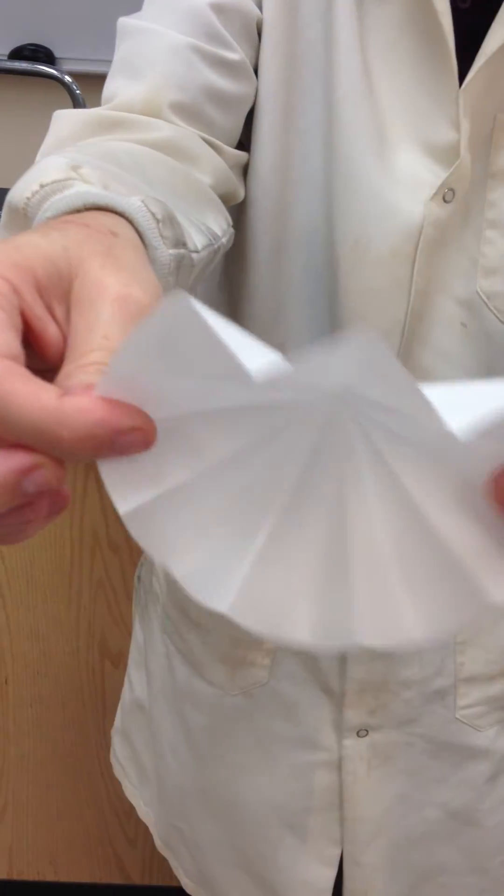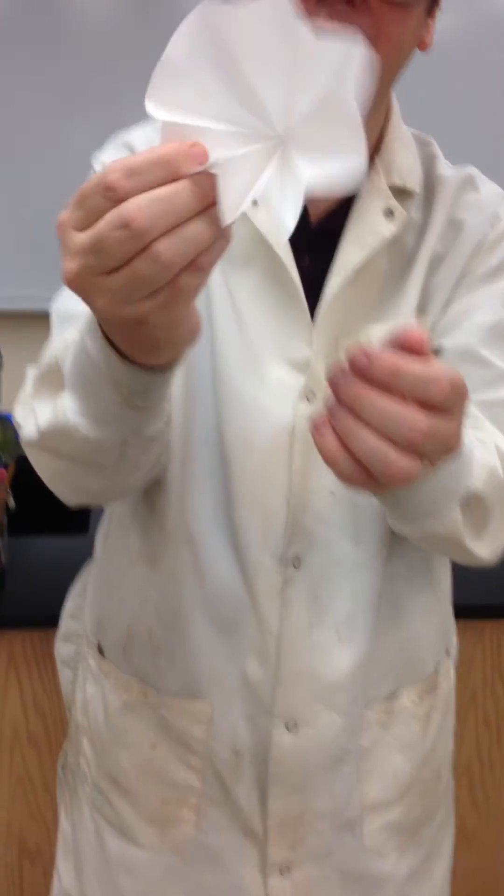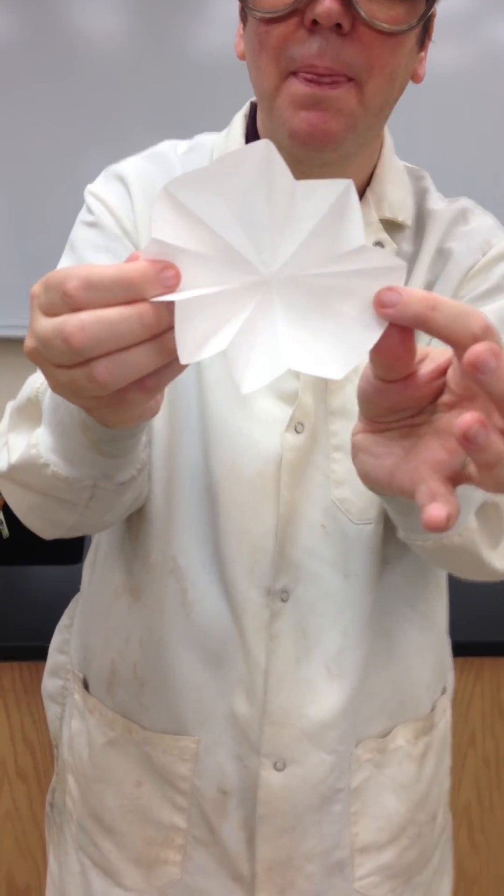Now I have my fluted filter paper. The benefit of this is I get to use 100% of my filter paper area without folding it over on itself. Thank you.